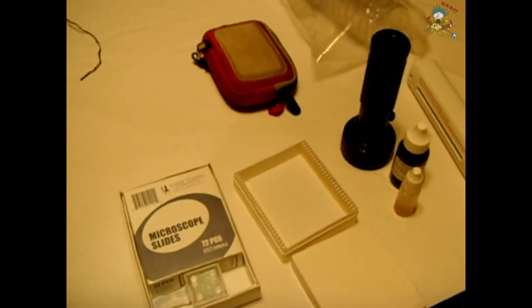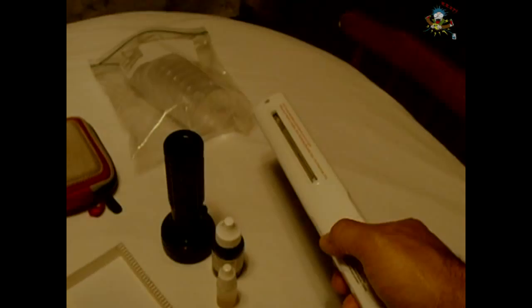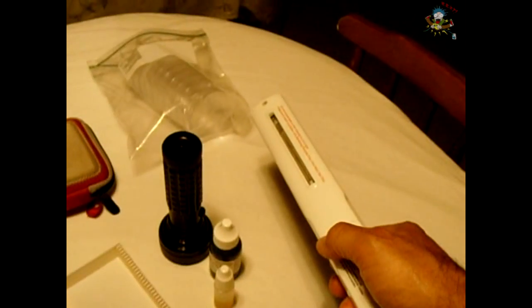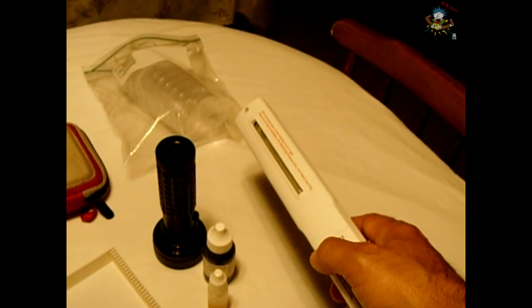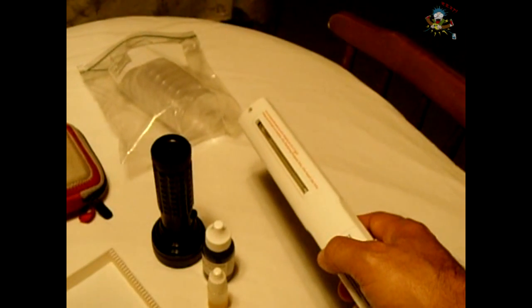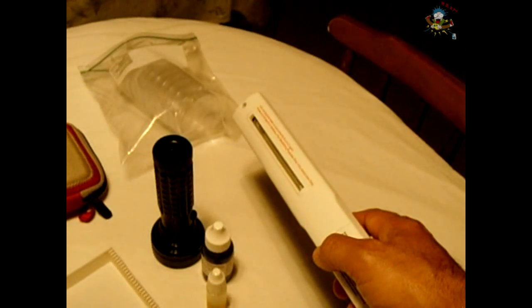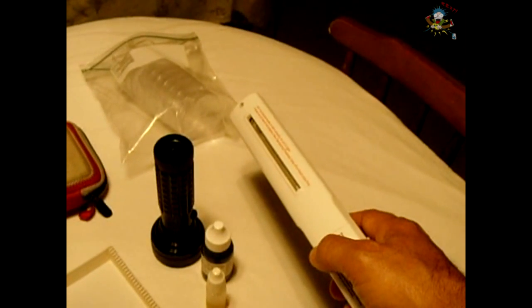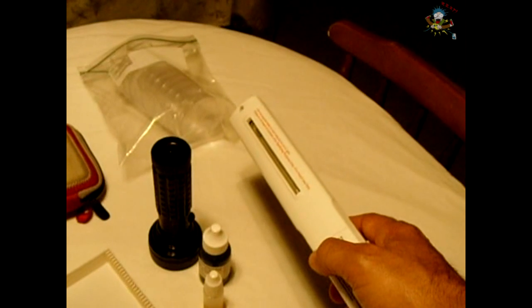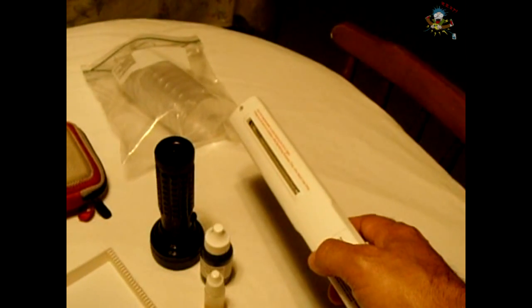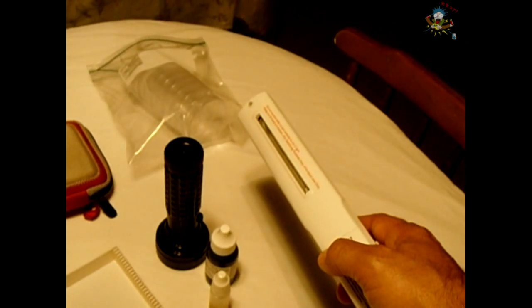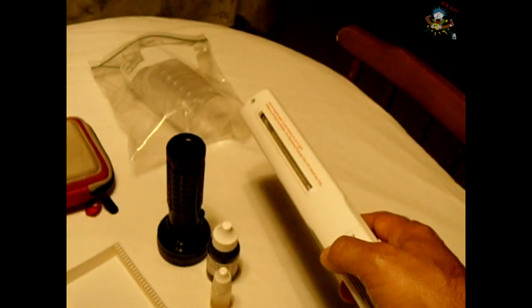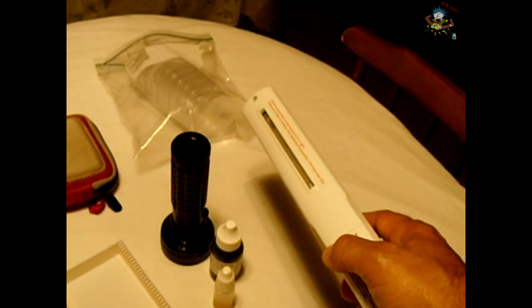Now what I'd like to do is take the UVC wand, place it right against the glass slide, and leave it turned on for approximately one minute. Now this is being advertised that after 20 seconds to a minute it will kill 99.9% of bacteria and viruses. So we're going to give this a test to see if there's any activity in the bacteria on the slide after the light has been removed. We're now going to take the UVC sterilizing wand, turn it on, hold it within very close proximity of this glass slide over the cover slip, and hold it there for approximately one minute and then turn it off.